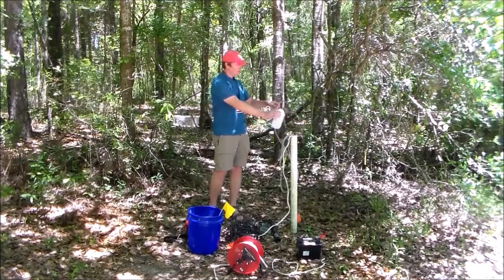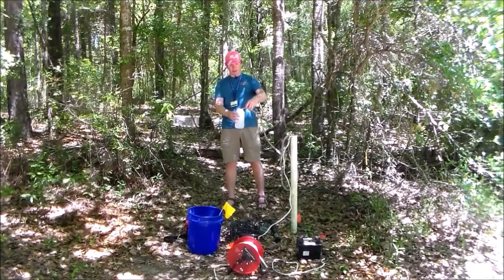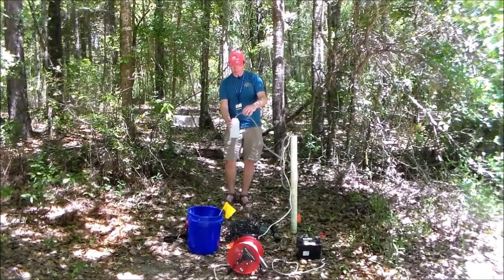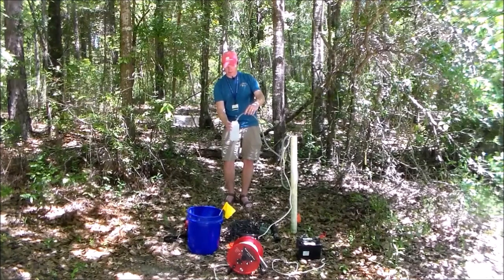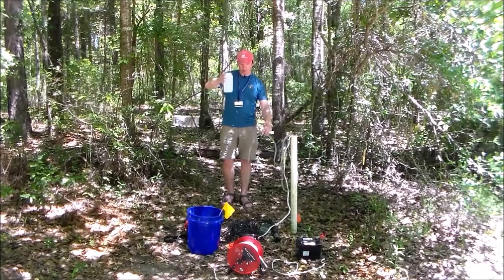So I'm gonna fill it up here, trying not to get my stuff wet. And I'm gonna stick this hose down in the bottom, and then you'll see I'm now gonna purge this bottle, in other words. And I'll let this overflow. And what I'm basically doing is I'm just trying to make sure there's no extra aeration or anything like that. Okay, now I can slowly pull the hose out.